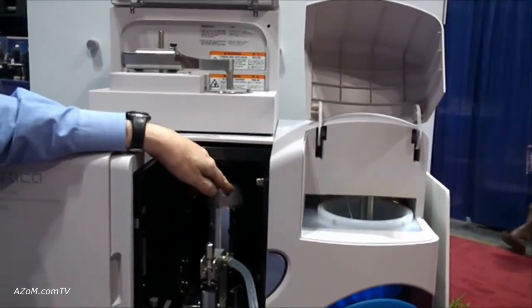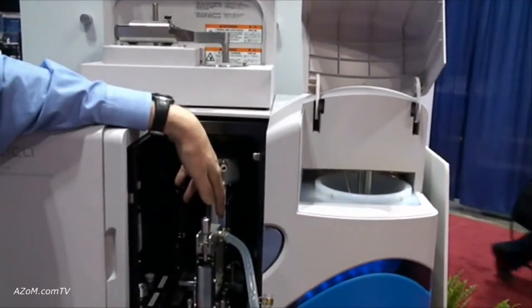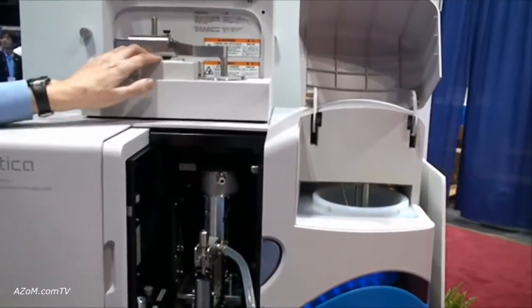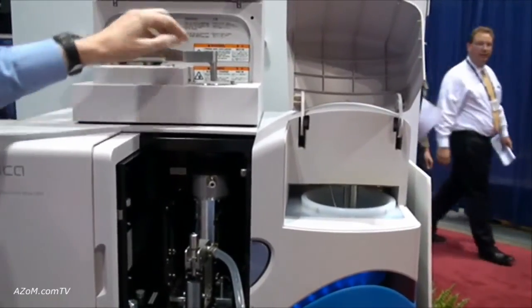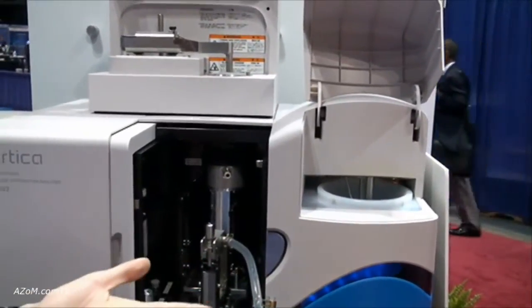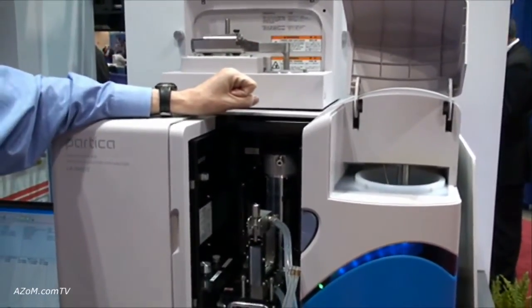It operates the same way as with the liquid sampler — as the particles pass through the cell we look at the scattered light and calculate the particle size distribution. In many ways dry powders are even easier than liquid suspensions, because after the powder falls through the cell it's just collected in a vacuum. There's really no cleanup; it actually keeps your lab cleaner, and you just change the vacuum bag once a month.